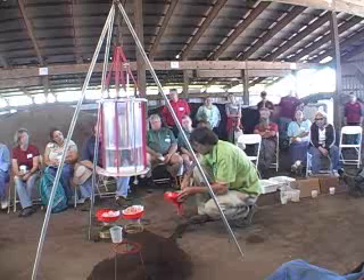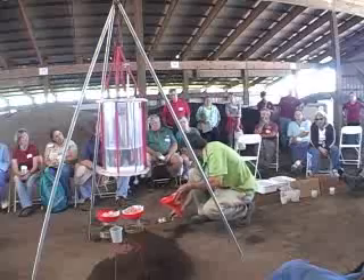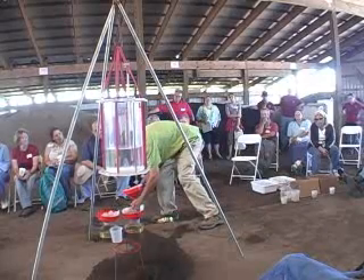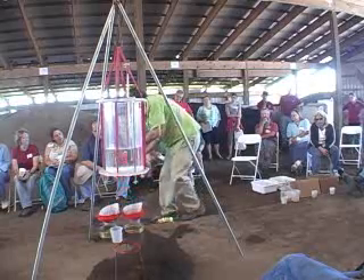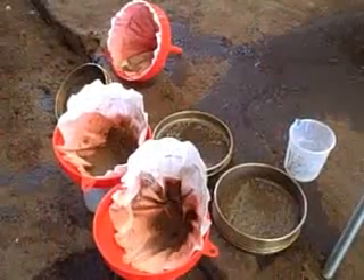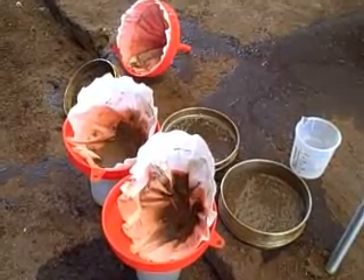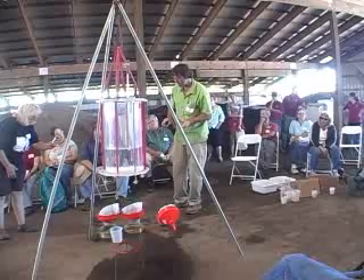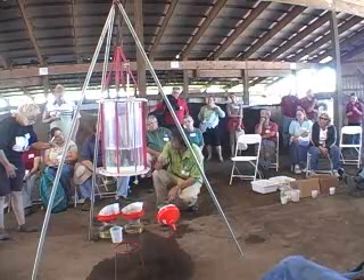Not a whole lot of the sand broke down and went through the filter. For sand, this aggregate stability test isn't the most important of all the tests we do — we discount it because it's not so important for sand. I do want to show that to get the idea that for sand, it's some of the other tests that matter more.